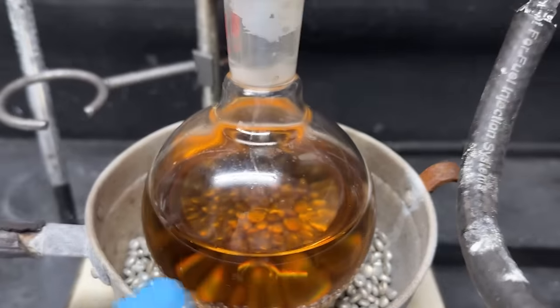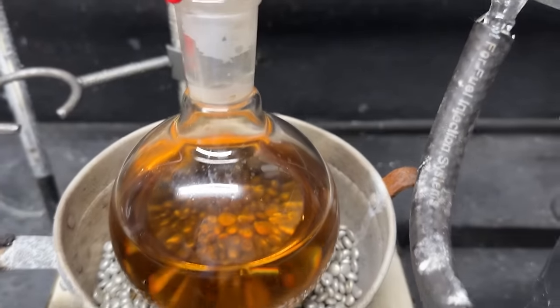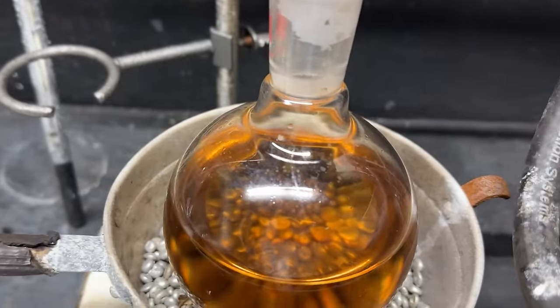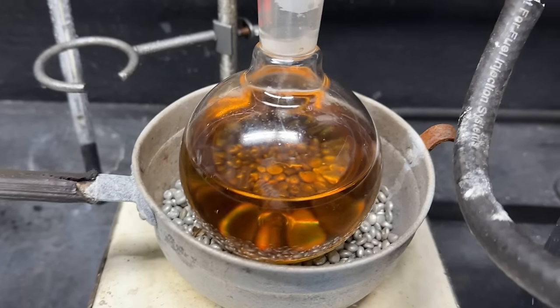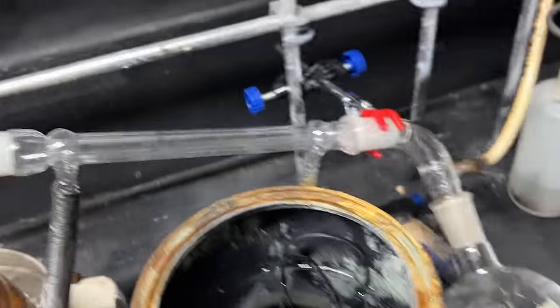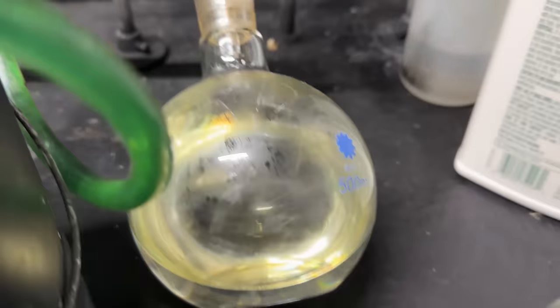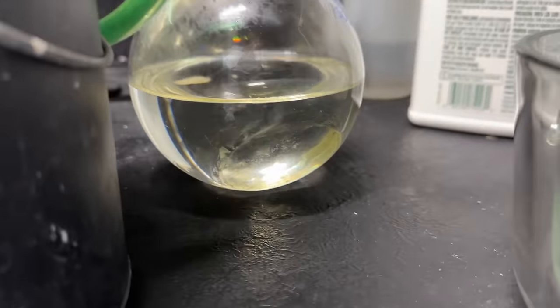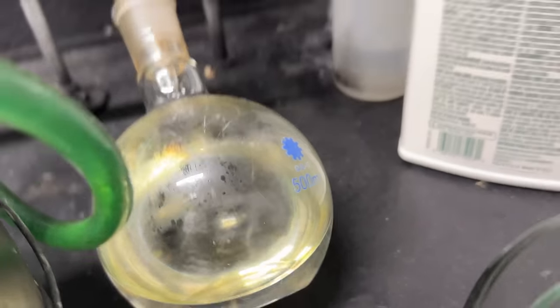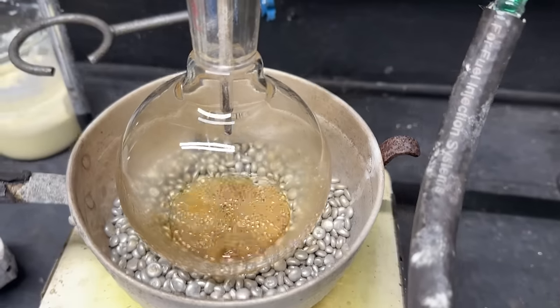As you can see, our acetophenone is not supposed to be that color — a nice dehydrated piss-yellow is what that is — so I'm just going to go ahead and crank the heat up and distill it over. Distillation is done for the most part and there's our acetophenone. I don't think it's actually yellow, but for some reason at the surface it looks yellow and then down below it looks clear.